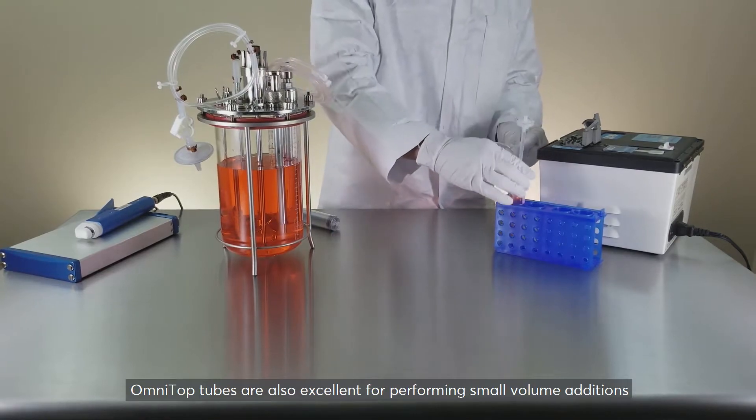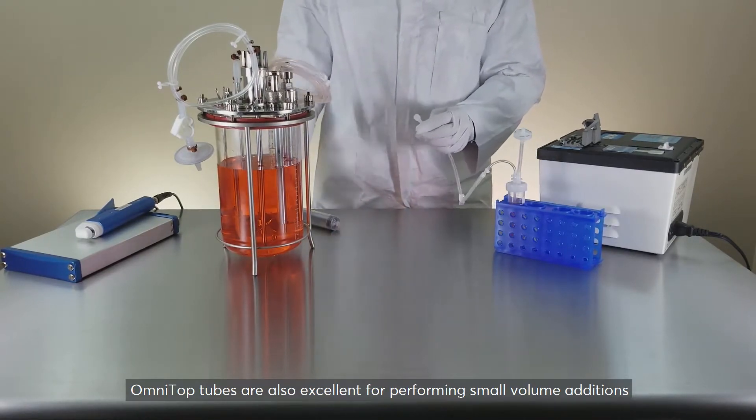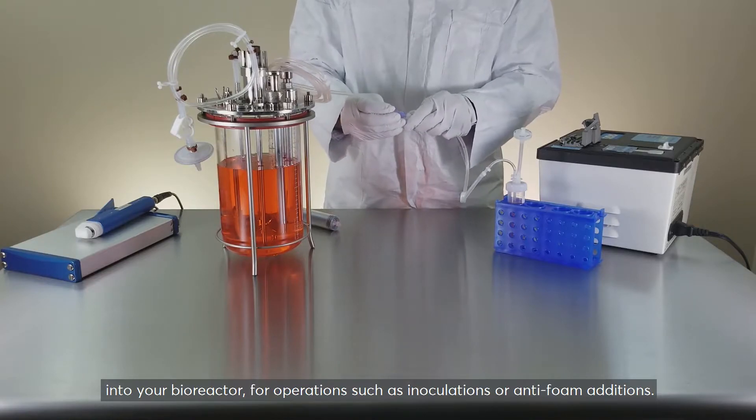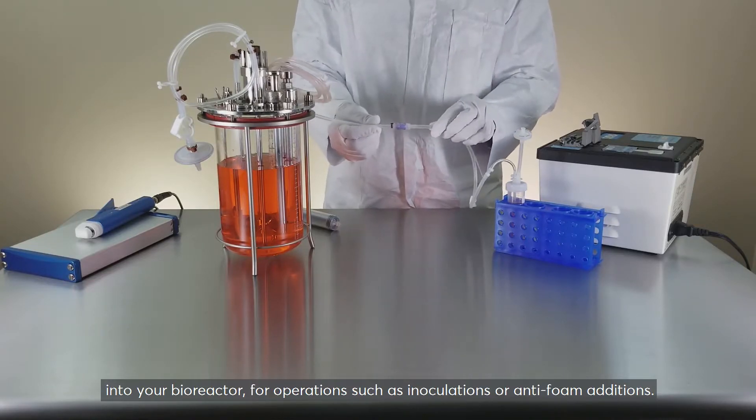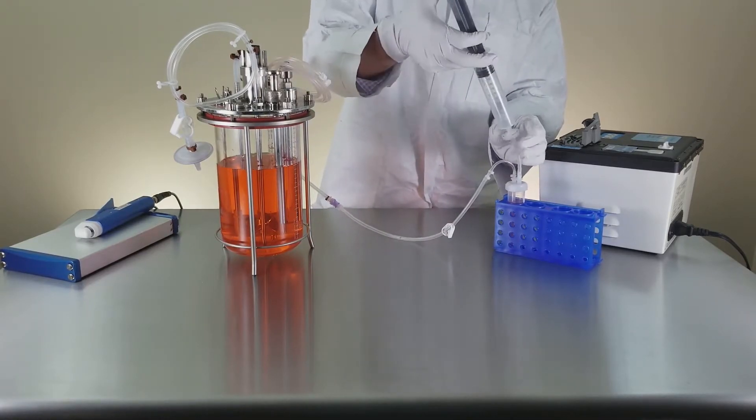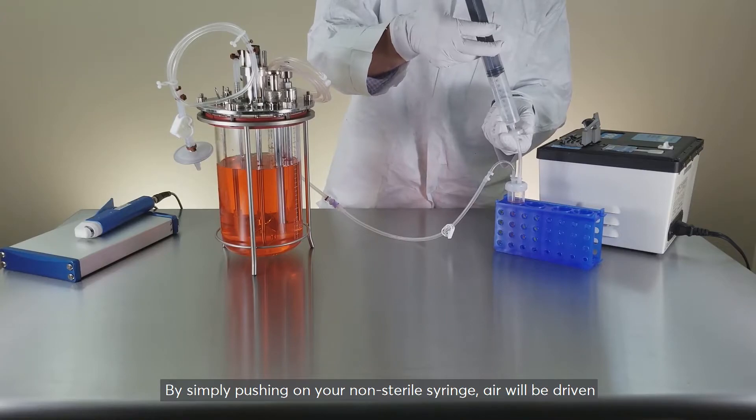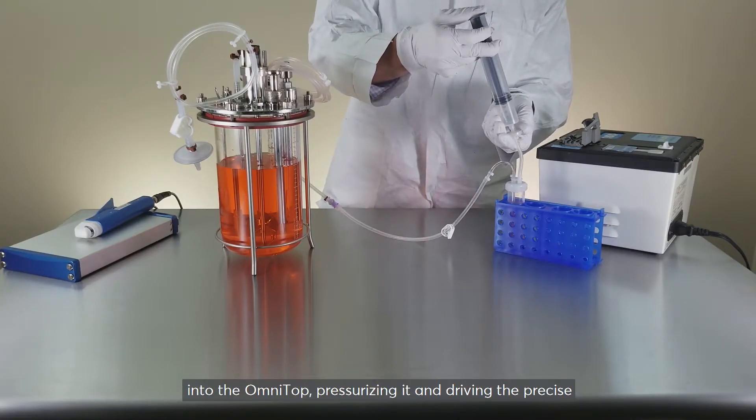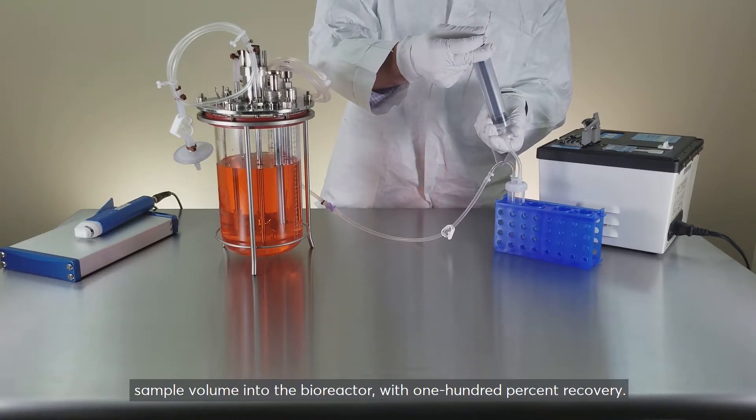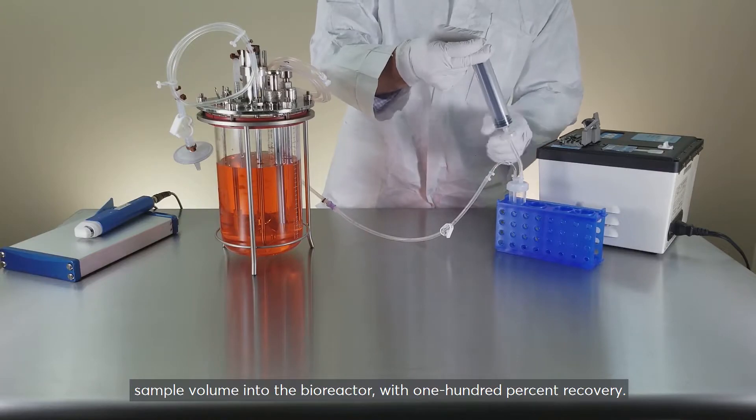OmniTop tubes are also excellent for performing small volume additions into your bioreactor, for operations such as inoculations or anti-foam additions. By simply pushing on your non-sterile syringe, air will be driven into the OmniTop, pressurizing it and driving the precise sample volume into the bioreactor with 100% recovery.